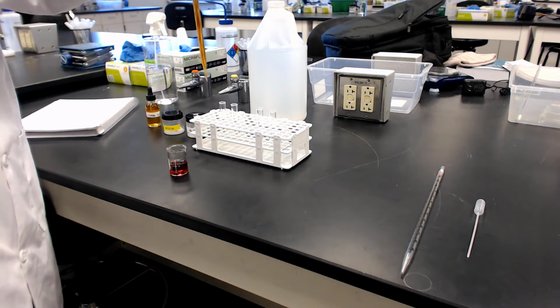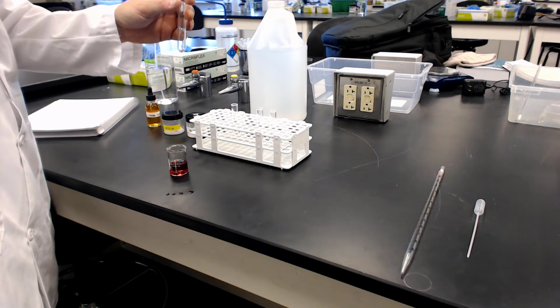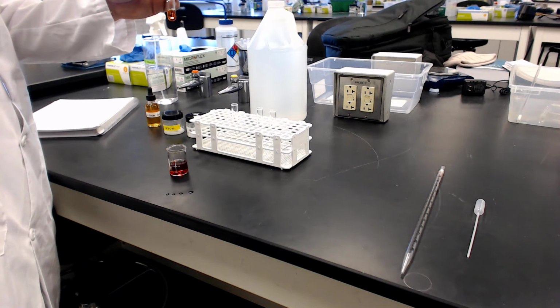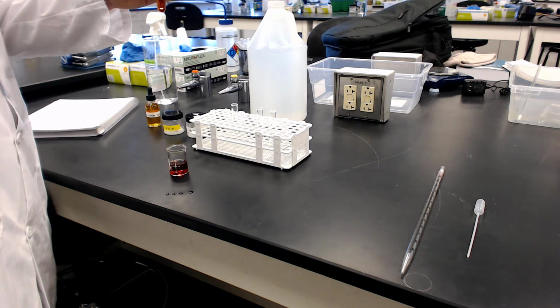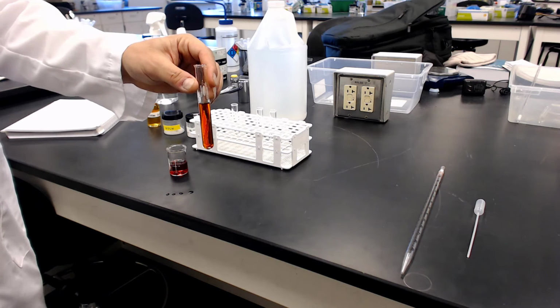And in this one, let's see how he handles it. It's kind of hard to see how he's dispensing, but if you're doing spectroscopy, you're trying to get an analytical measure where it's really important that you do volume correctly.